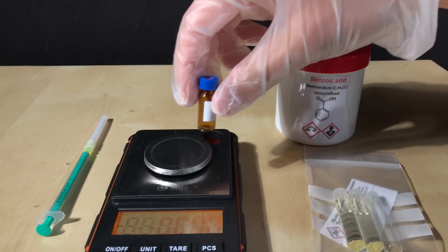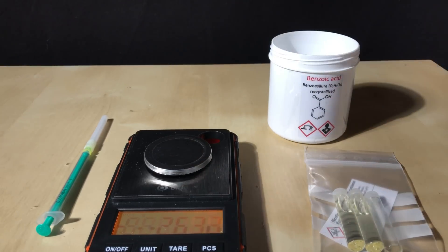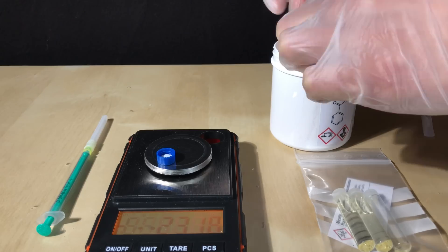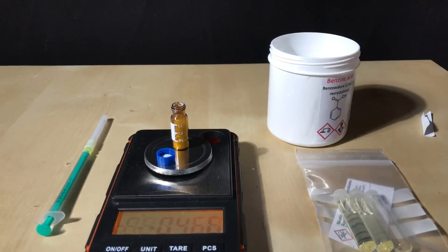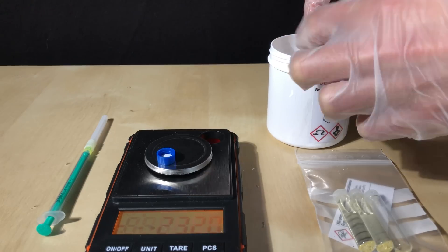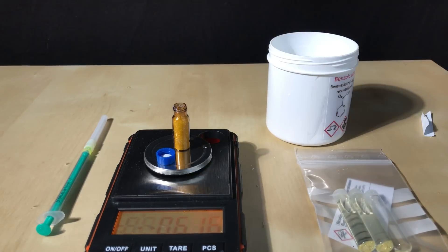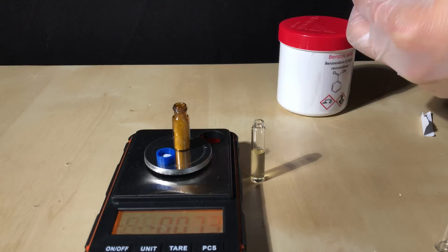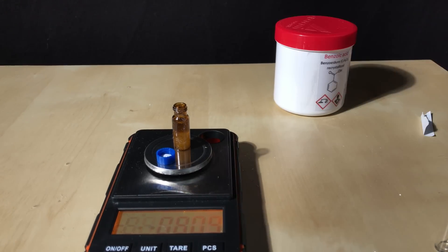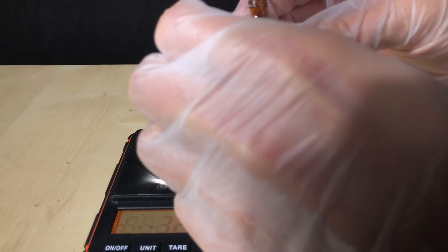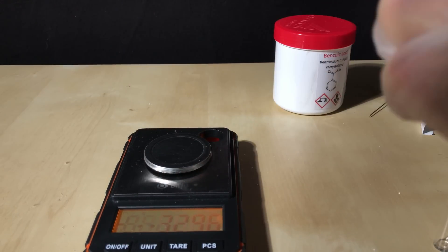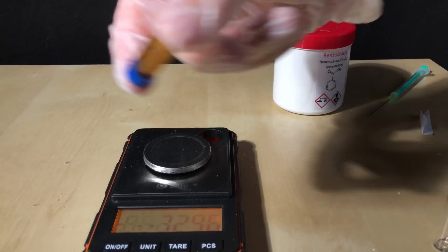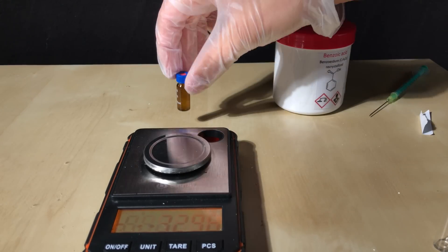I felt like doing another project with the nicotine, which was to make nicotine benzoate. In order to do this we only needed to mix 0.81 grams of nicotine with 0.61 grams of benzoic acid. I don't recommend smoking or vaping to anyone, but nicotine benzoate is often used in electronic cigarettes. It enters the bloodstream a lot faster than pure nicotine and is thus deemed to be much more addictive. The nicotine benzoate made in this video should not be consumed under any circumstances. It might be contaminated, and besides that, smoking and vaping are bad for your health. Once the ingredients were weighed out, we only had to shake the vial and the nicotine benzoate was finished.